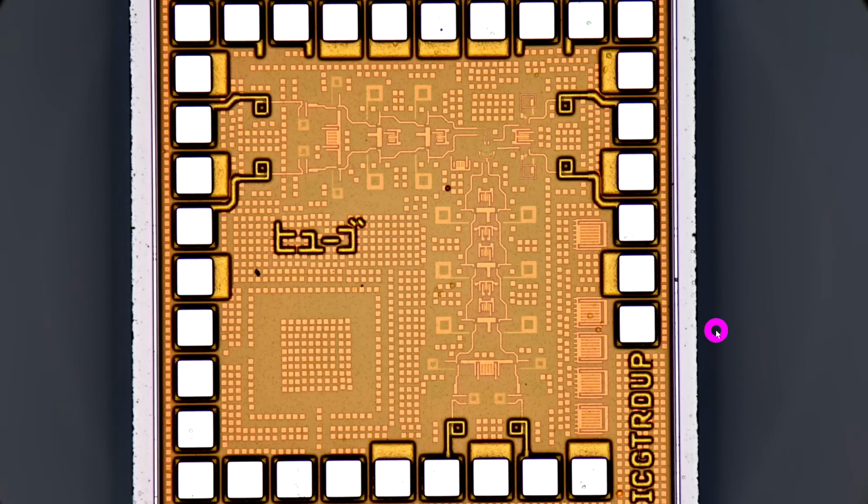Now, the depth of field of any lens can be relatively easily calculated. It's a function of its magnification, its numerical aperture, as well as the resolving power of the sensor that is capturing this image, in this case, the Nikon camera. You can use a formula and it will give you the depth of field. So I went ahead and incorporated that into the microscope control software that I had written before.